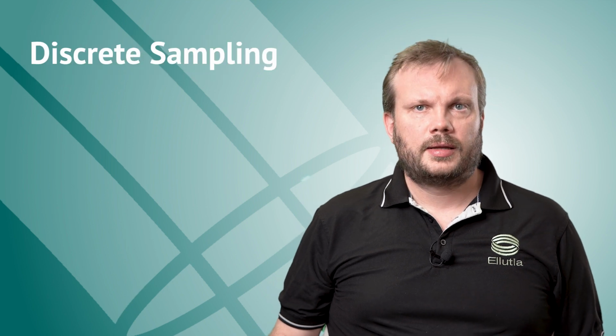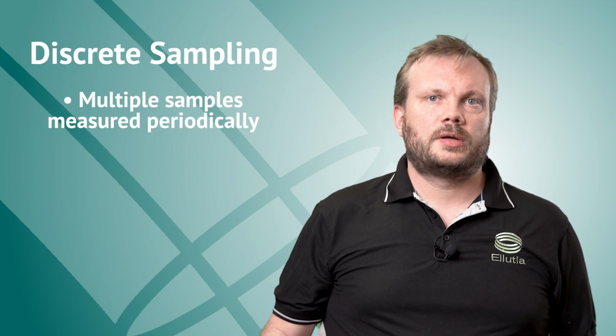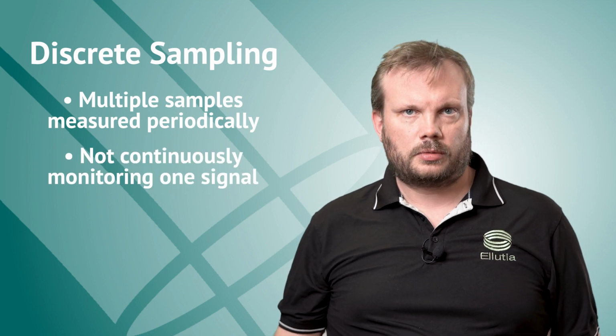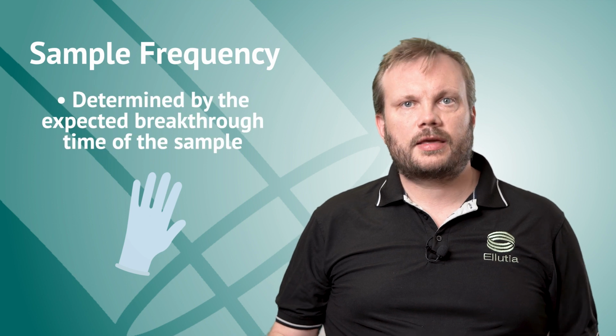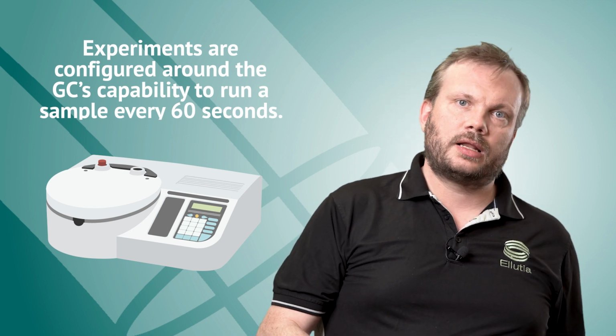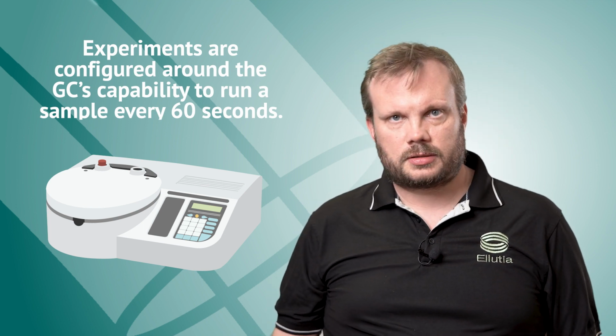The system operates using discrete sampling. This means that multiple samples are measured periodically as opposed to a continuous monitoring of one signal. How often a sample is taken will be determined by the expected breakthrough time of the sample. How we configure experiments is planned around the GC's capability to run a sample every 60 seconds.